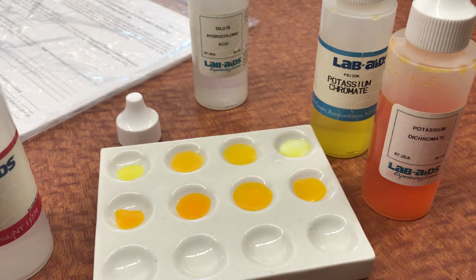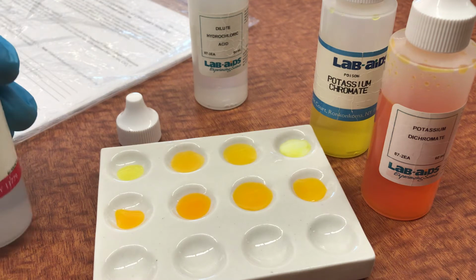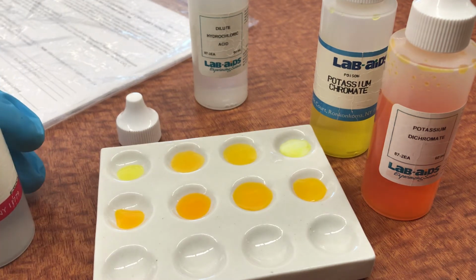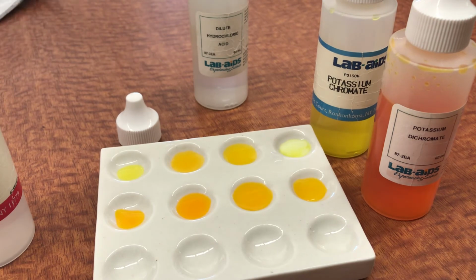And so could we reverse this reaction? Well, actually no, it should not be. Barium chromate is supposed to be a solid. Oh, but I added barium nitrate. Okay, good. Okay, so that's why. Yeah, very good. Okay. Just going to flip the page.